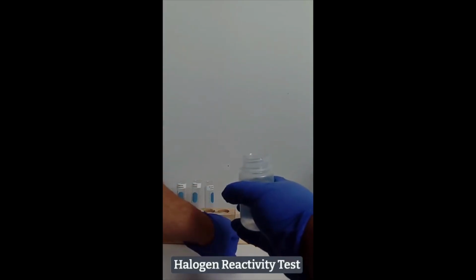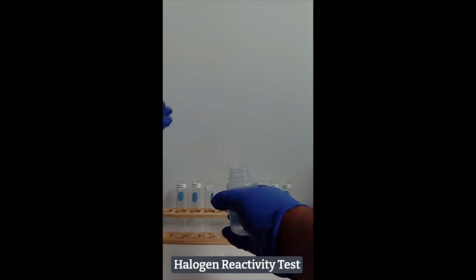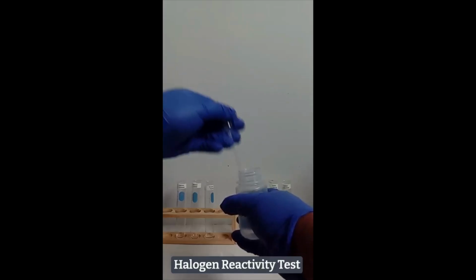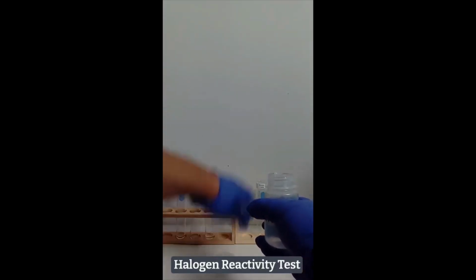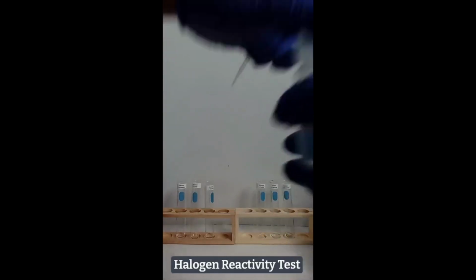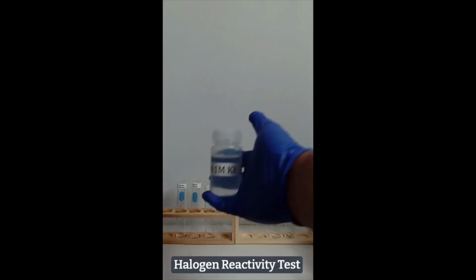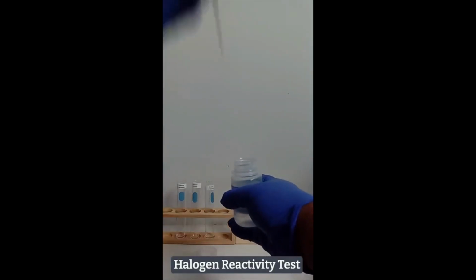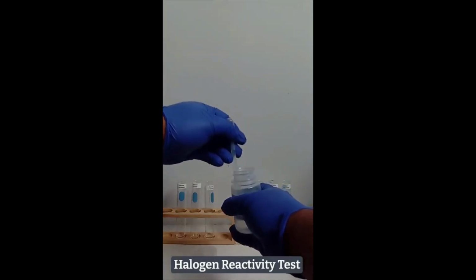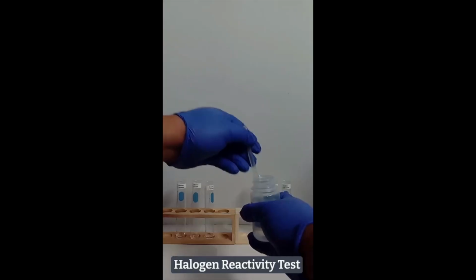Next, a similar volume of 0.1 molar potassium bromide is added to test tubes 1 and 6. Now, a similar volume of 0.1 molar potassium iodide is added to test tubes 2 and 4.